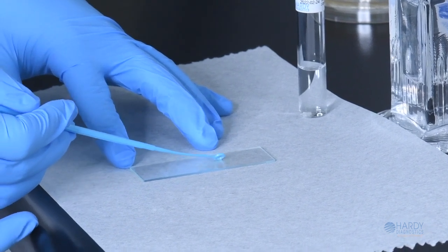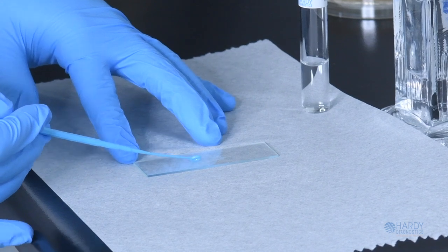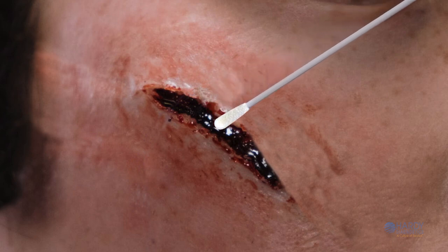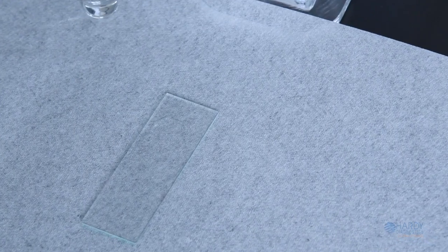Using cells from a single colony is important, as this should represent only one cell type rather than a mixture of cells. Ideally, the culture should be between 18 and 24 hours old, because older cells may show variable results. Alternatively, you can use a collection swab from a clinical specimen or environmental sample. Do not heat the slide. Wait for the sample to air dry.